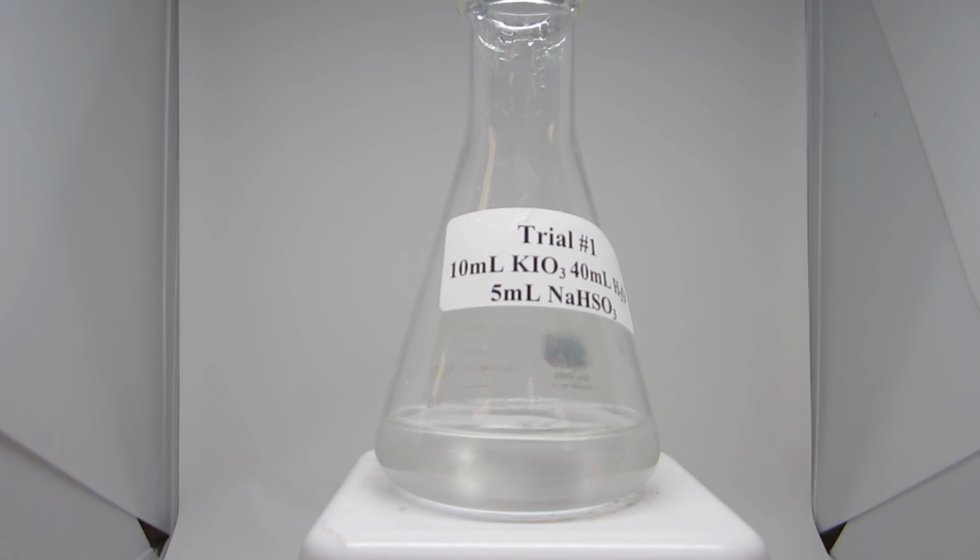You will notice the time between reactions keeps getting longer and longer. The time difference between the reaction of 50 milliliters potassium iodate and 40 milliliters potassium iodate was very small. Yet, the time difference between 20 milliliters of potassium iodate and the current trial of 10 milliliters potassium iodate is very long. This is because time is related to the concentration in a logarithmic way. In the report, you will be plotting the time and the concentration on a log scale.